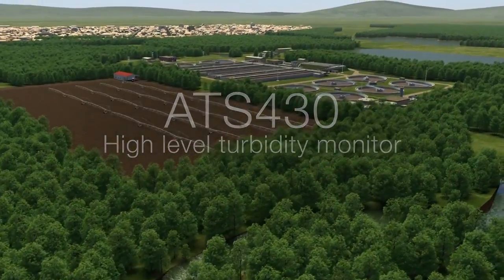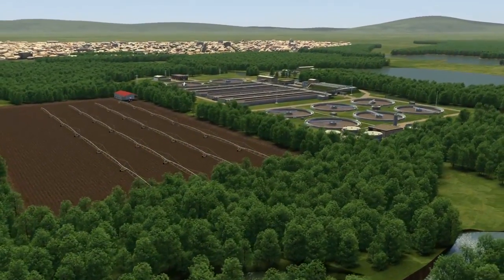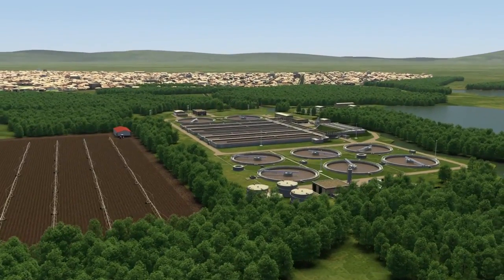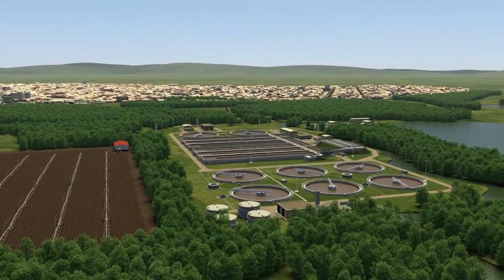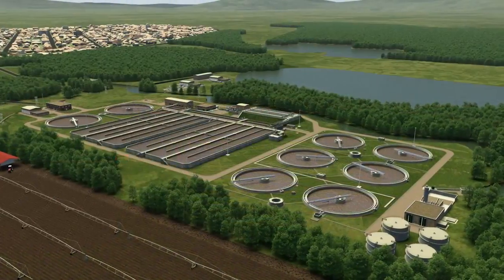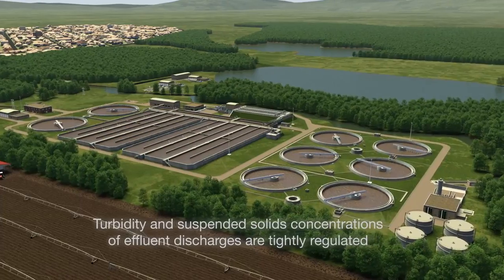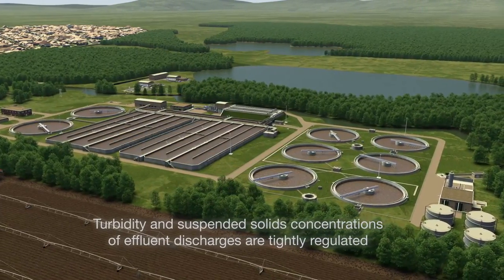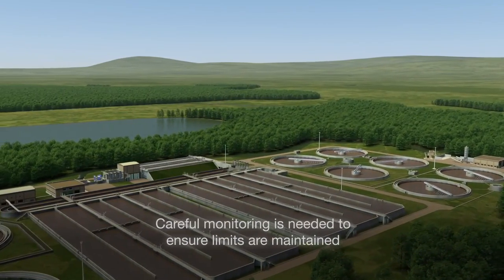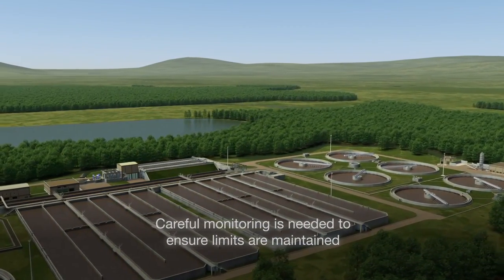Controlling turbidity and suspended solids levels in treated wastewater discharged to the environment is vital to ensuring the health of rivers and streams and preventing damage caused by depletion of dissolved oxygen levels. For this reason, turbidity and suspended solids concentrations of effluent discharges are tightly regulated and need to be carefully monitored to ensure limits are maintained.